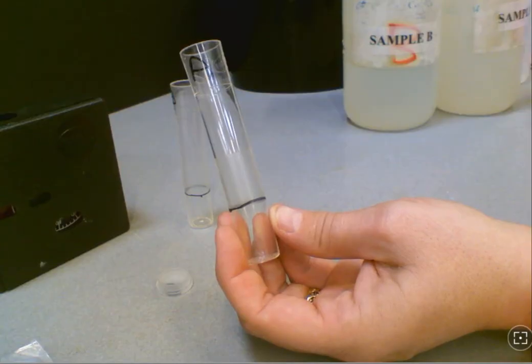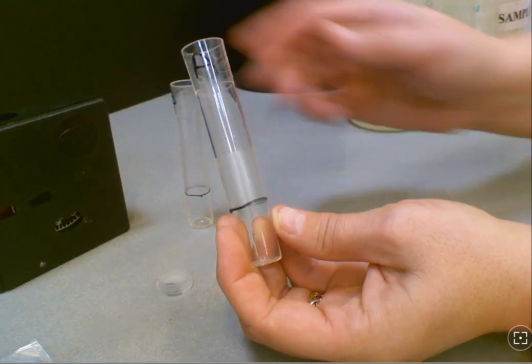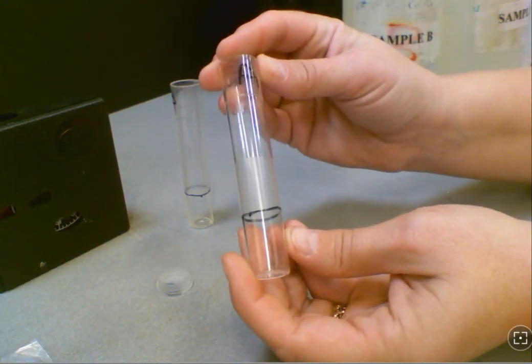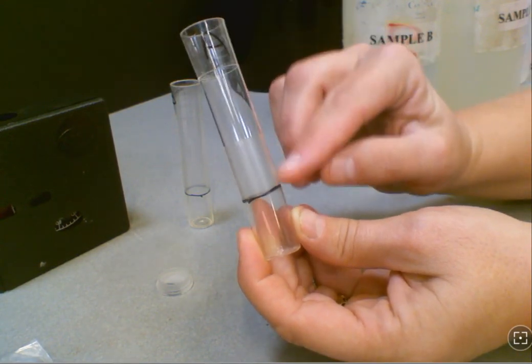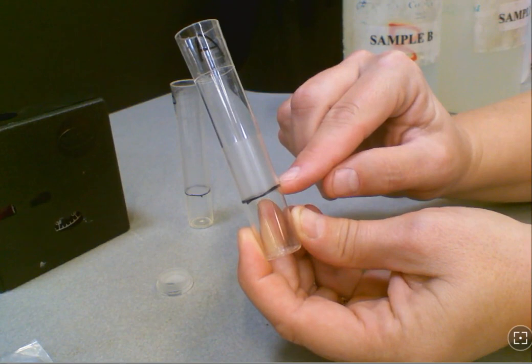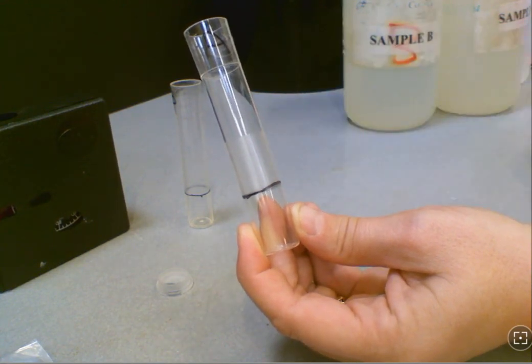We want to talk about the lab equipment. In the instructions it says fill to the bottom line. There is no line clearly marked other than the marker you see on this tube. The bottom line is the bottom of the shaded area that you're looking at in this particular sample tube right there, so you're going to fill it up to there and that would be the appropriate amount of sample water.